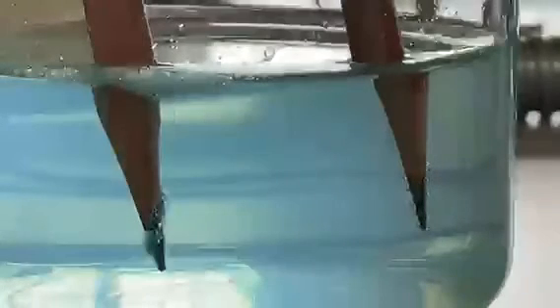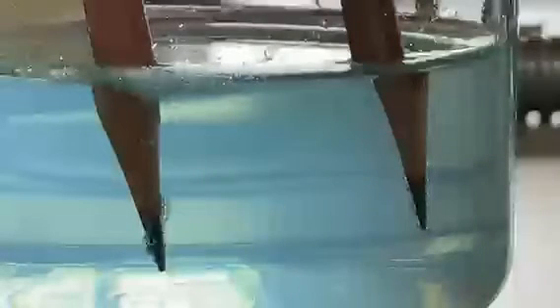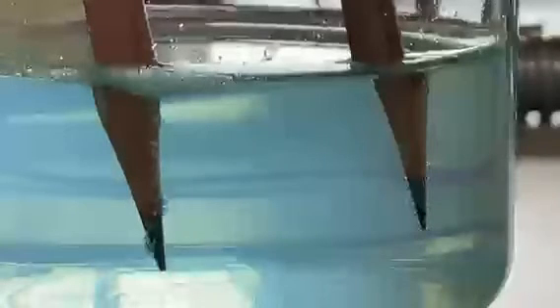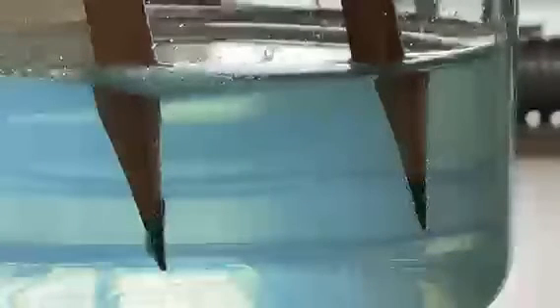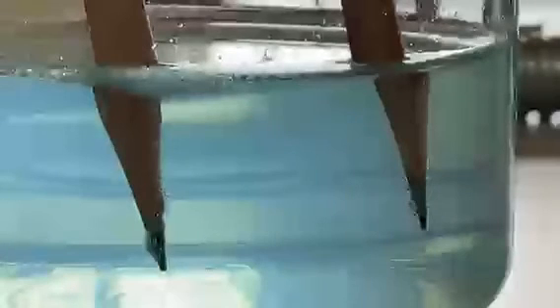After going through these two experiments, we can first deduce that the power source can influence the rate of reaction of the electrolysis, where the voltage is proportional to the rate of reaction, meaning that as the voltage of the power source increases, the speed of the reaction will increase as well.